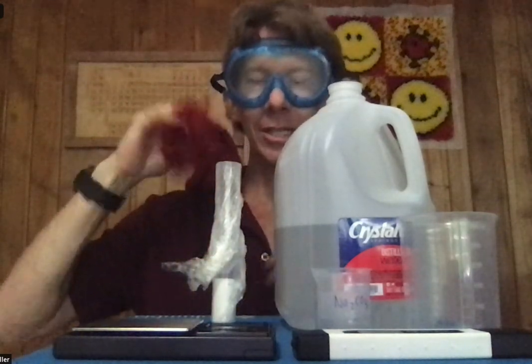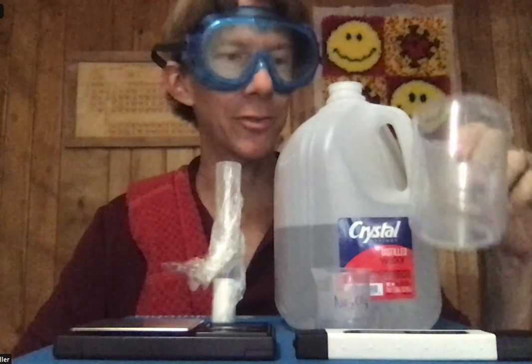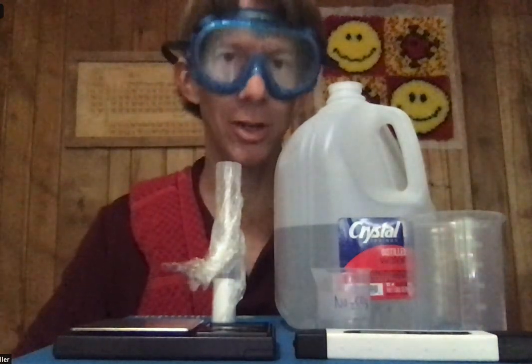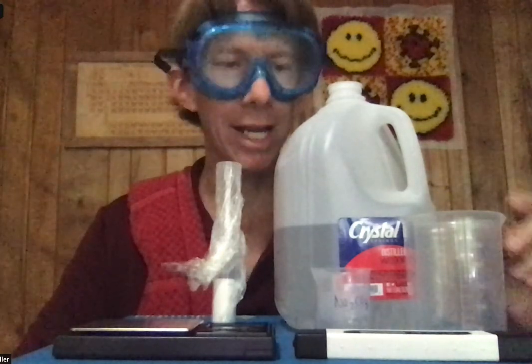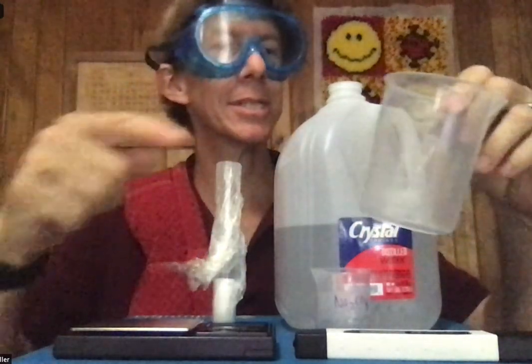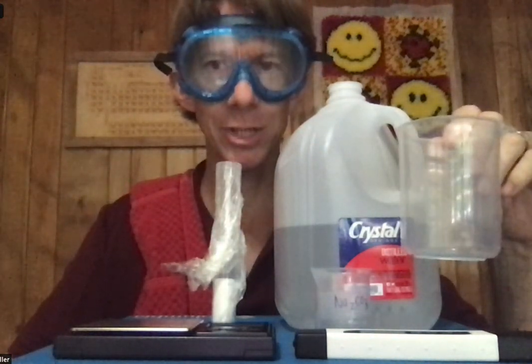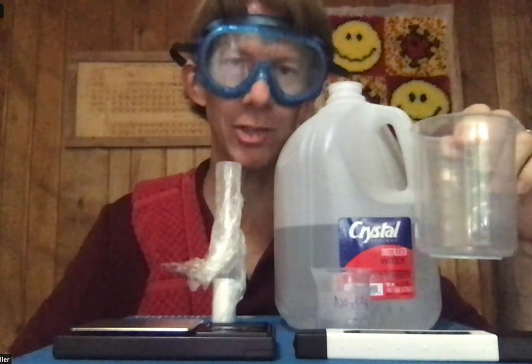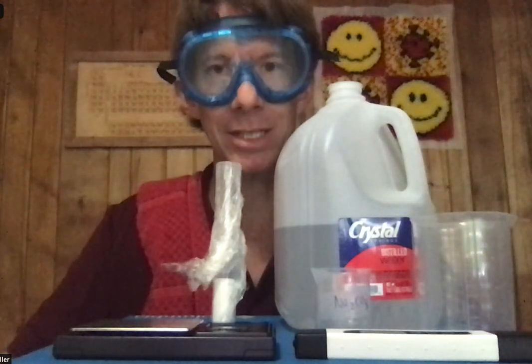I've got my goggles on because I'm working with chemicals and solutions, and a kitchen towel to dry the 250 milliliter beaker between trials. You do need it clean and dry the first time — take the mass of it. For subsequent trials, you can rinse it with deionized water. As long as you note you're using the same beaker mass each time, you can subtract the mass of the clean dry beaker, even with a small amount of deionized water remaining.